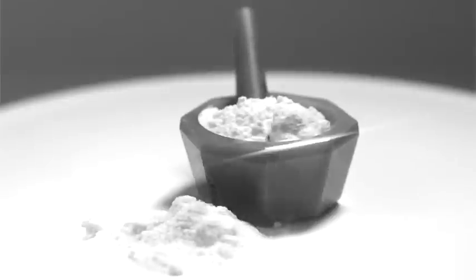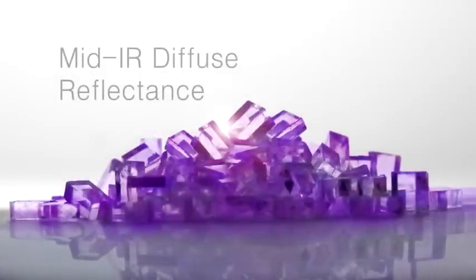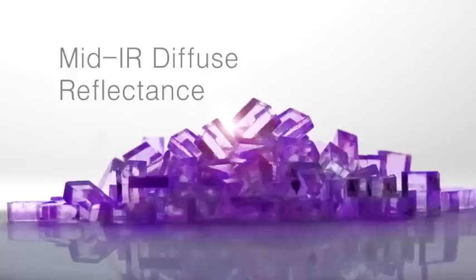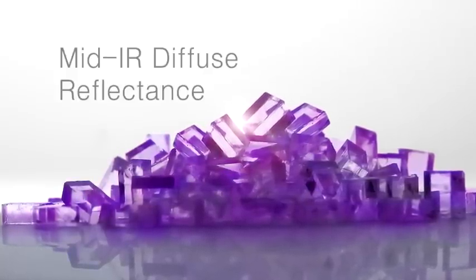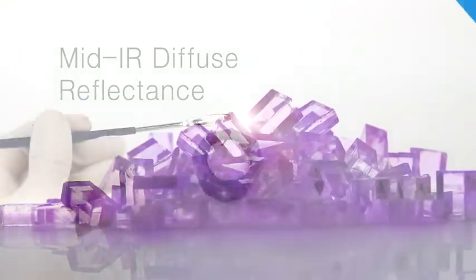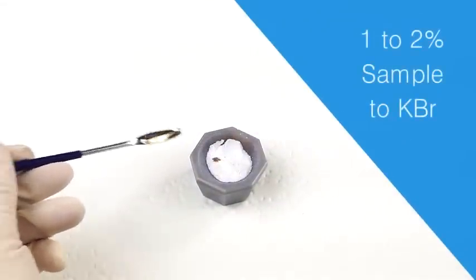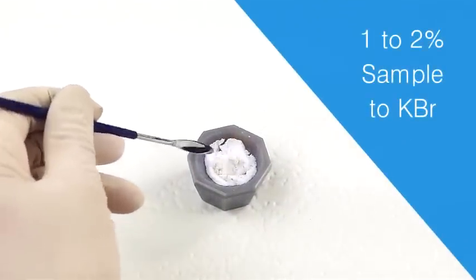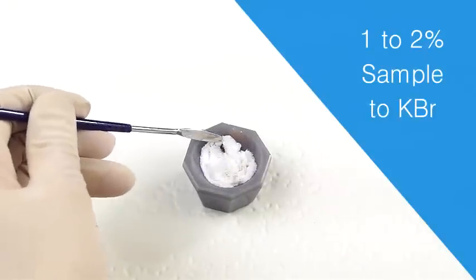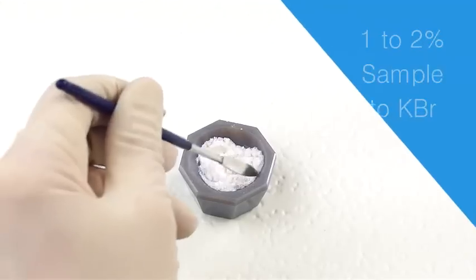For powders and crystalline materials, mid-infrared diffuse reflection sampling, like KBR transmission measurements, is a sensitive technique without the hassle of making a pellet. For diffuse measurements of powders, samples are generally diluted with KBR. One to two percent sample concentration to KBR is a good starting point. However, trial and error by adjusting the concentration up or down may be needed to optimize spectral results.